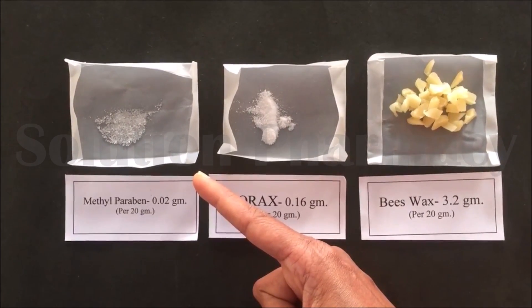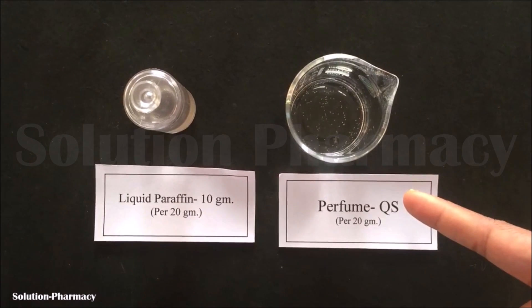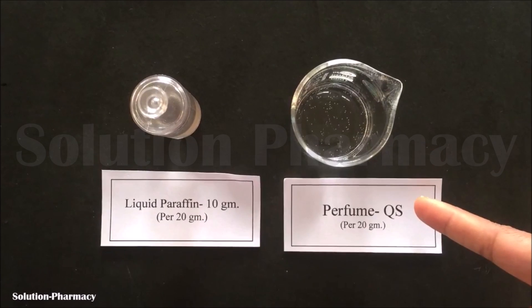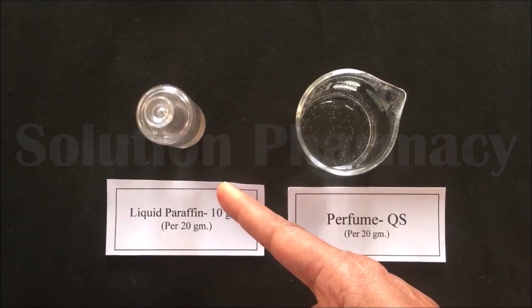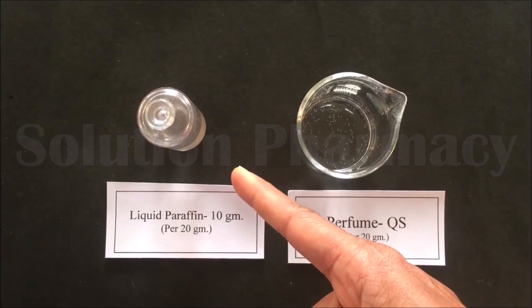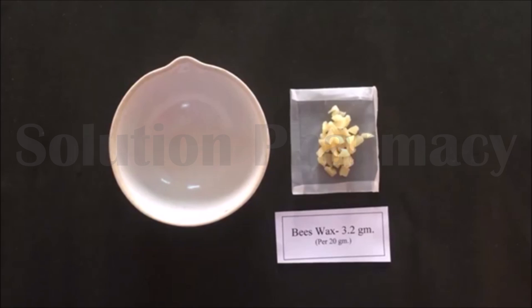Next is methylparaben as a preservative — here we have weighed 0.02 grams of methylparaben. Next is the perfuming agent — here we have taken rose oil; we have to add a sufficient quantity of rose oil at the time of preparation. Next is liquid paraffin — we have weighed about 10 grams of liquid paraffin. In place of liquid paraffin you can also use almond oil or coconut oil.